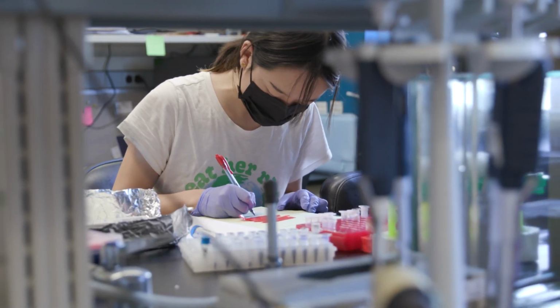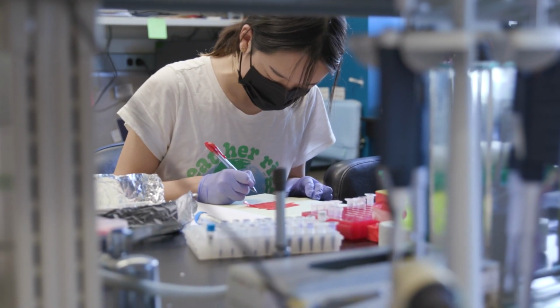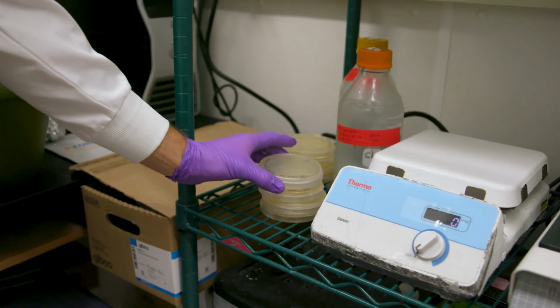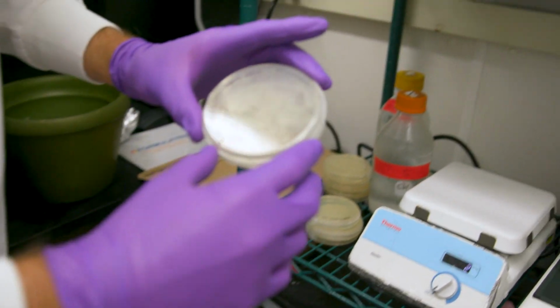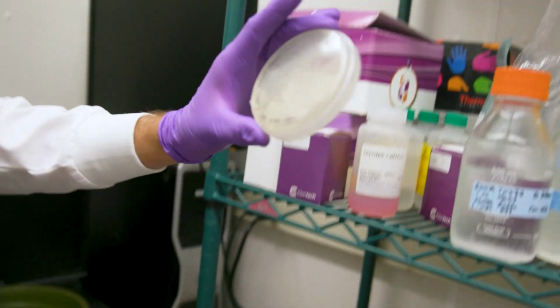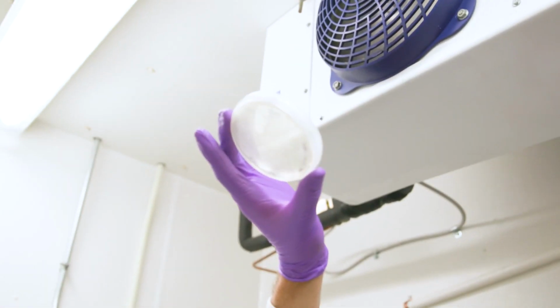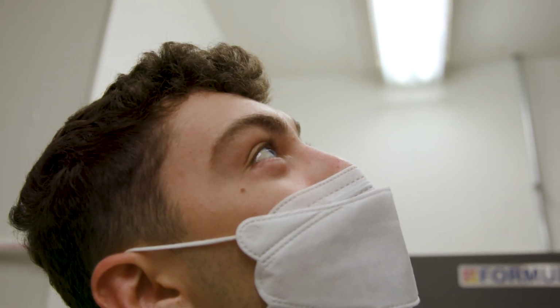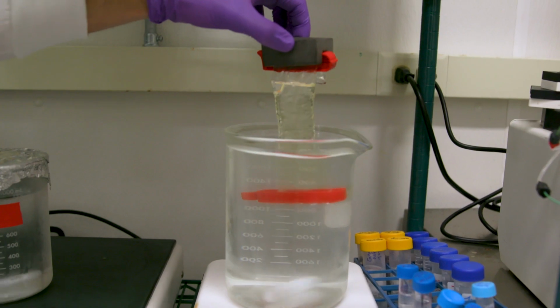Things like, let's say, SARS-CoV-2 mutations. We can develop a platform where we can take samples from patients and in real time solve the structures of these viral particles, which would then allow us to delineate these mutations and how they may actually be evading vaccines.